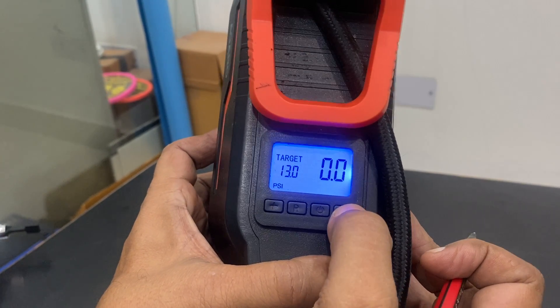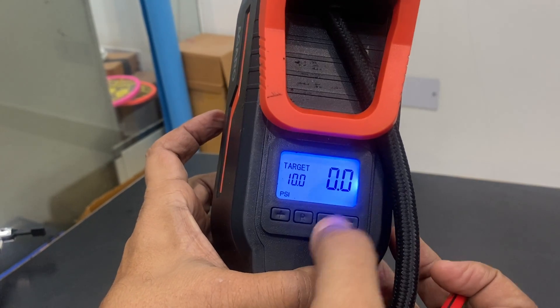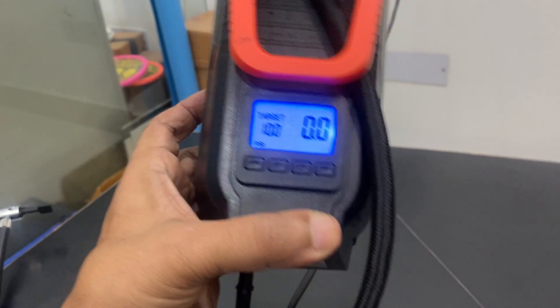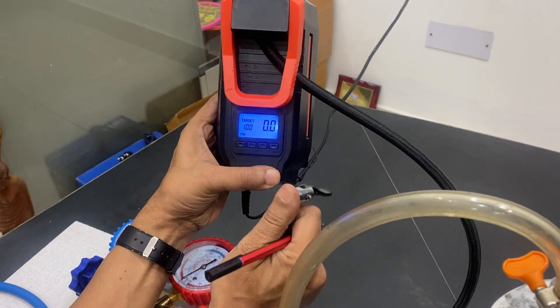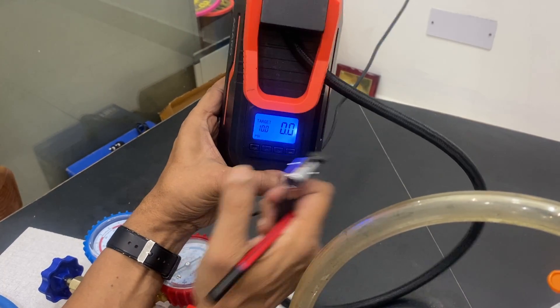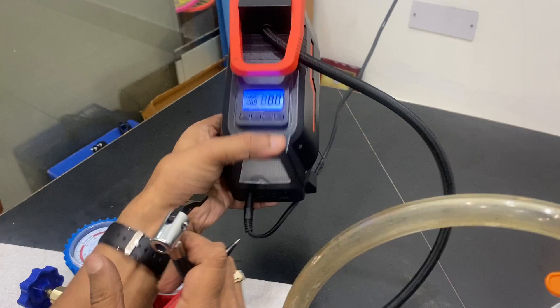This is an automatic pump. It will stop when the air in the chamber is filled to 10 psi — automatically. When you press it, it starts. I will just show you how it works. I am putting a finger here to demonstrate. See, now it has stopped, and it has stopped at 10 psi.